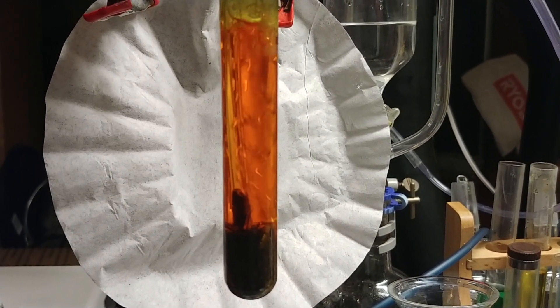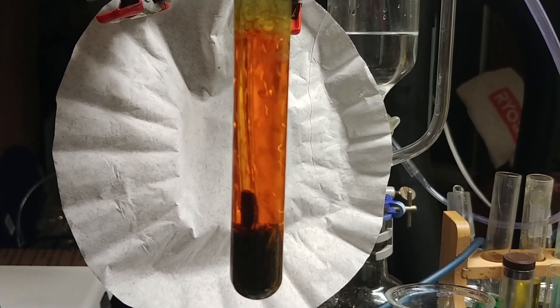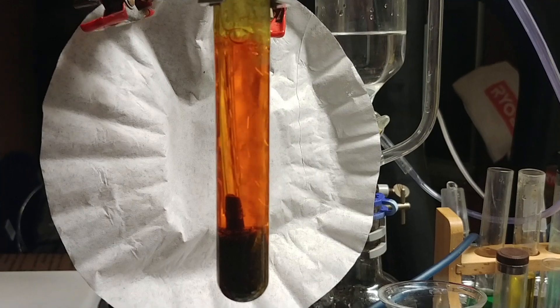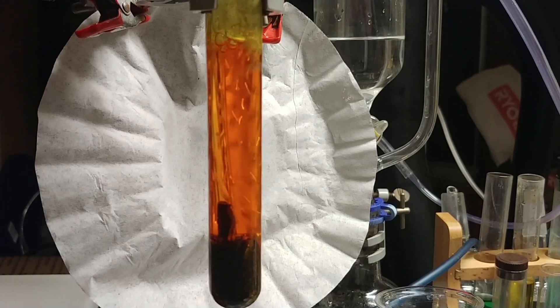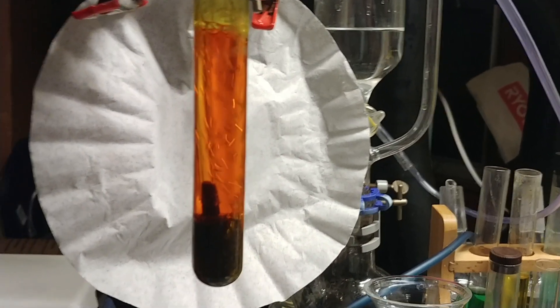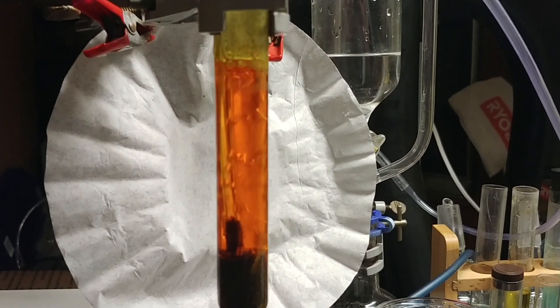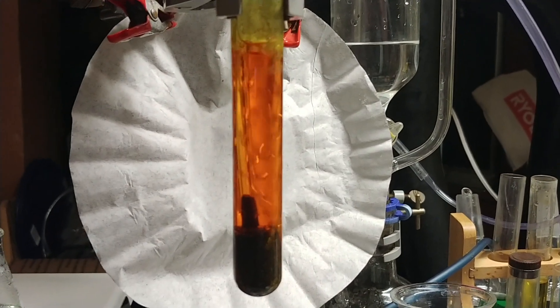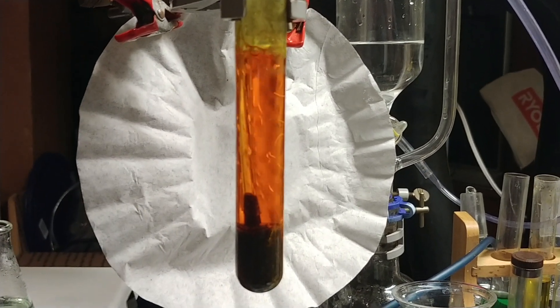Here I'm oxidizing polysulfides. Sodium hydroxide was used to solvate elemental sulfur, which creates sodium thiosulfate as well as a number of polysulfides. Polysulfides are readily oxidized to thiosulfates. What I've been doing is the long process of just bubbling air through, and since I've become a little bit impatient about that — it does work, which I can show in a moment.